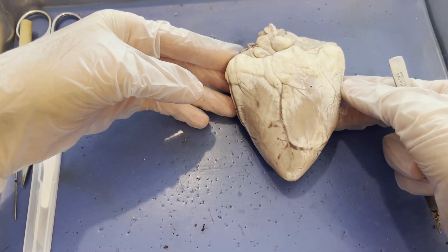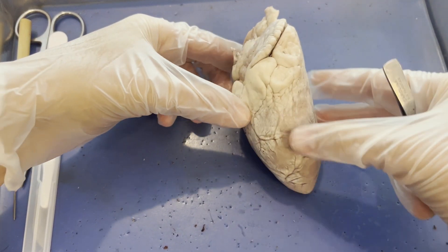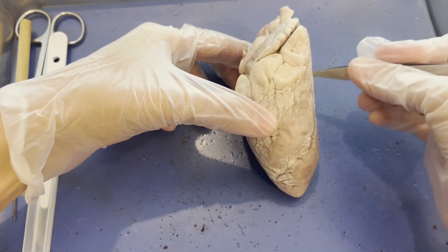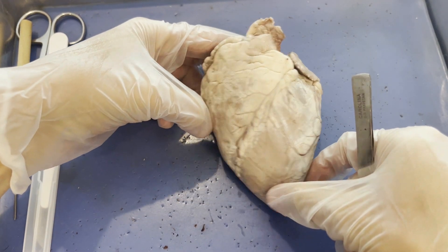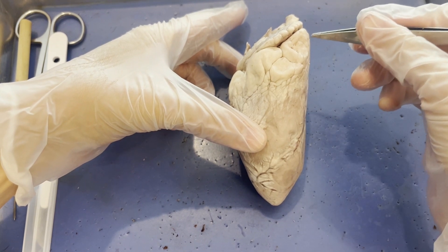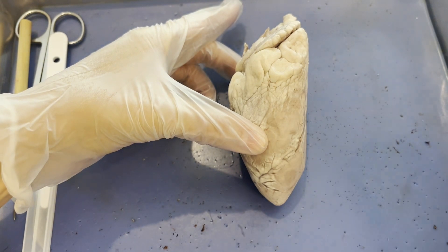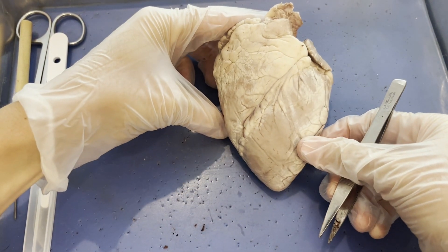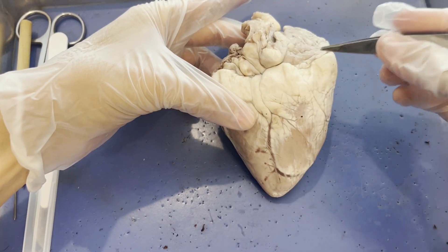You don't see the same trend on the posterior side of the heart. Another easy way to determine anterior versus posterior is to notice how much higher the anterior side comes up on the heart, compared to how much lower the posterior side goes down. The anterior side is much higher than the posterior side.